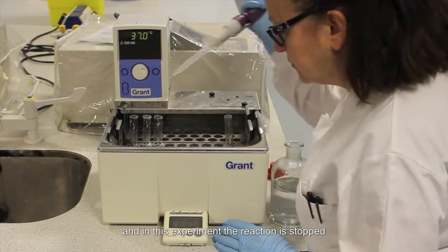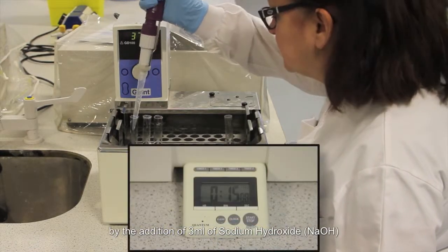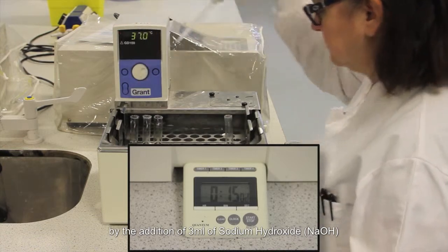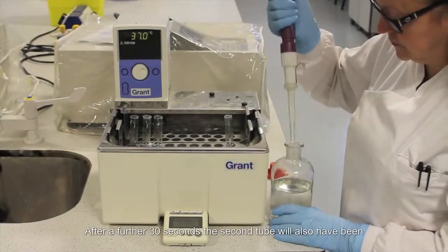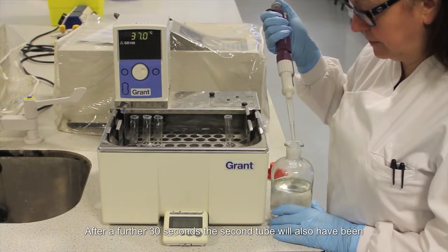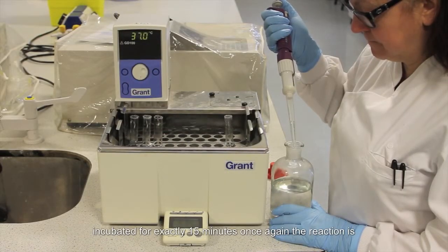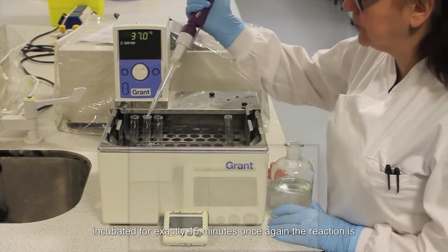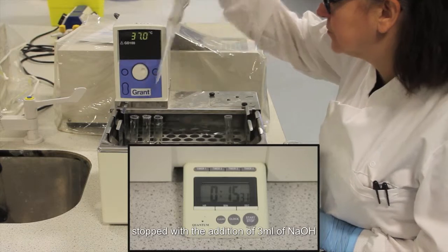In this experiment, the reaction is stopped by the addition of 3 millilitres of sodium hydroxide. After a further 30 seconds, the second tube will also have been incubated for exactly 15 minutes. Once again, the reaction is stopped with the addition of 3 millilitres of sodium hydroxide.